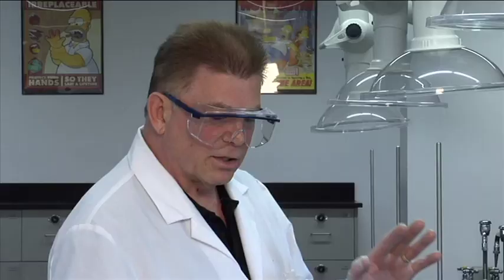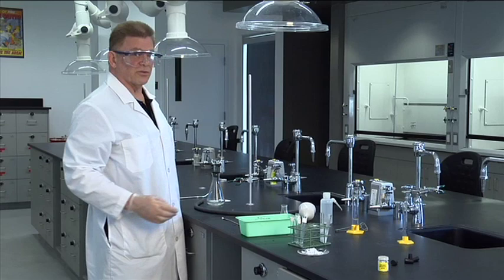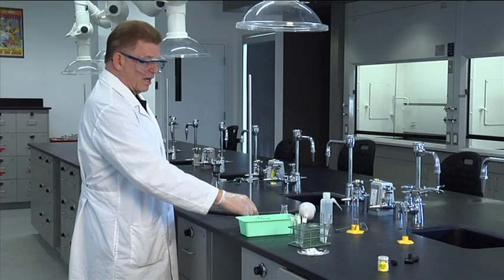We're going to pour out the - don't pour out the liquid and leave the crystals behind. You want to do a good swirl and a quick dump usually. That's the best way to get the crystals out. You may have to scrape the side of the flask. Sometimes the crystals will adhere to the side. You may have to do some scraping before you dump out.